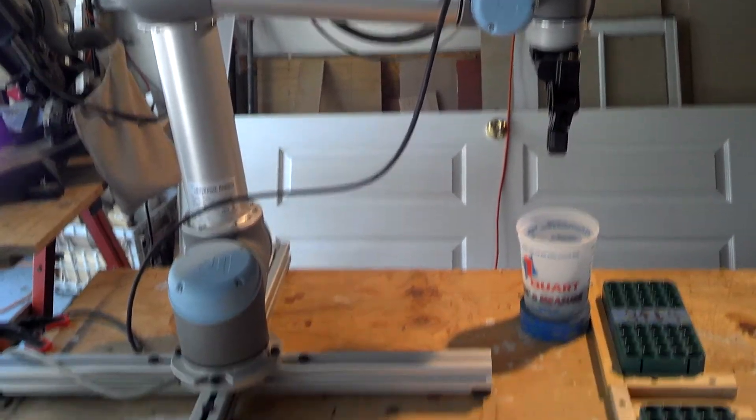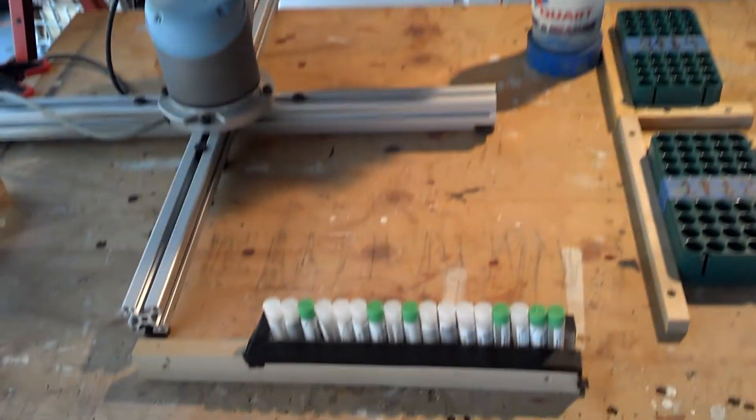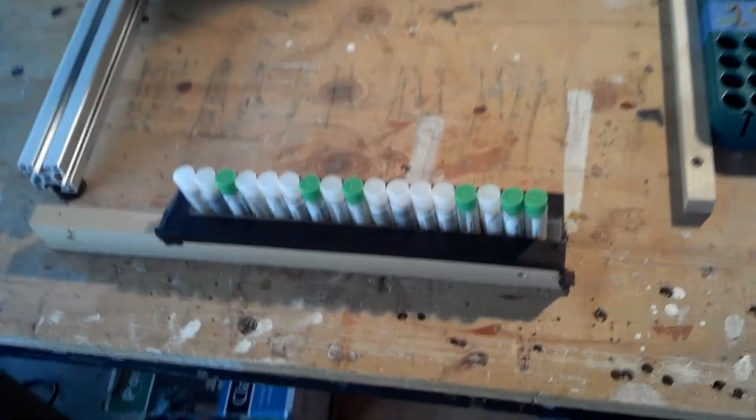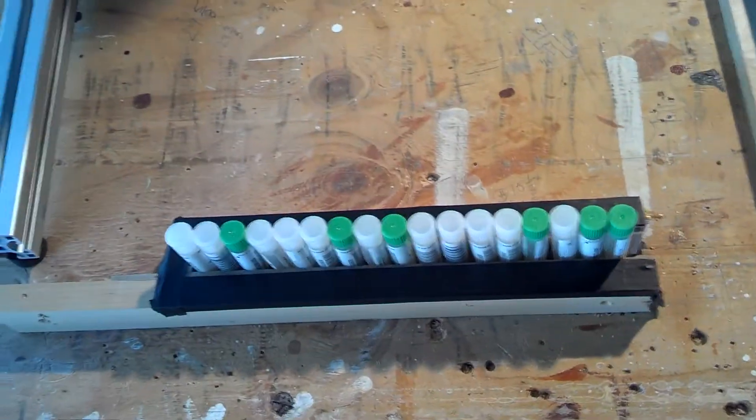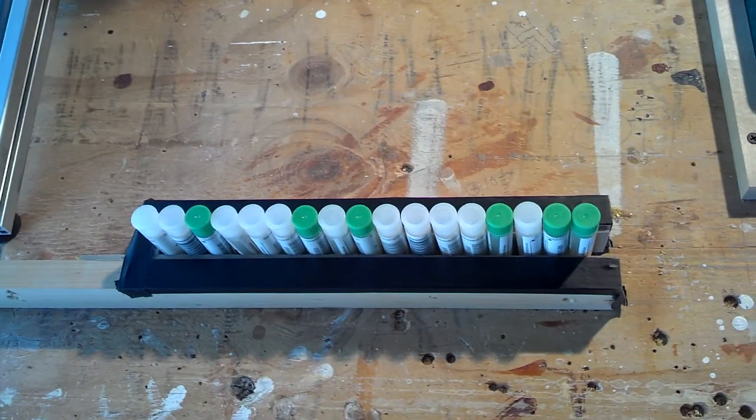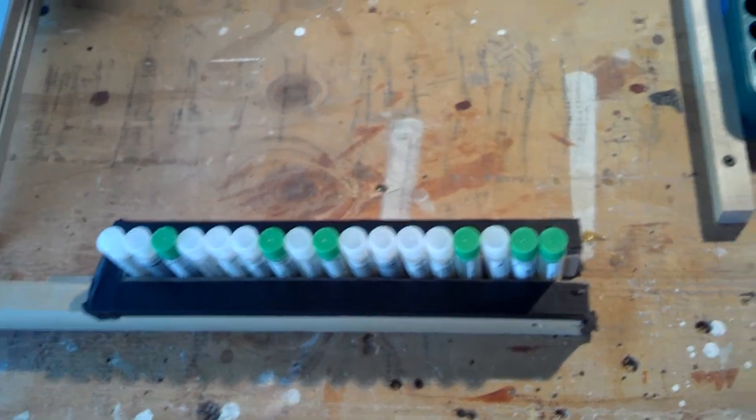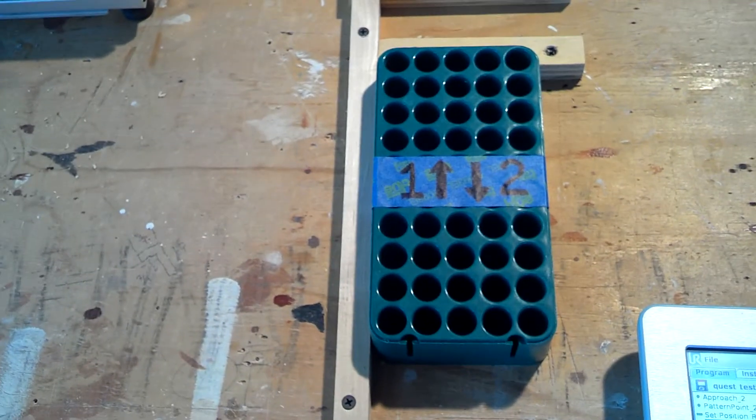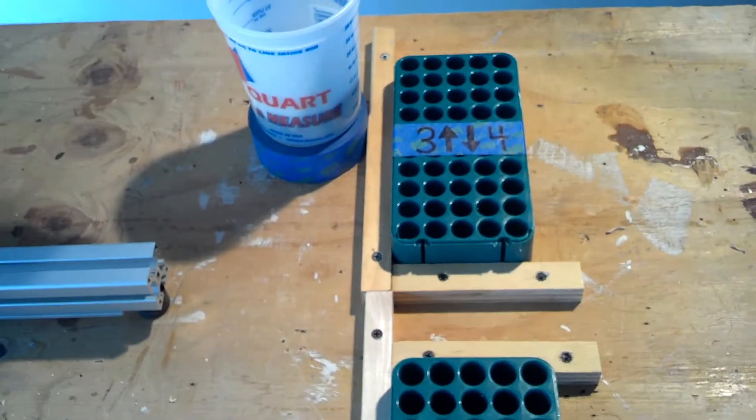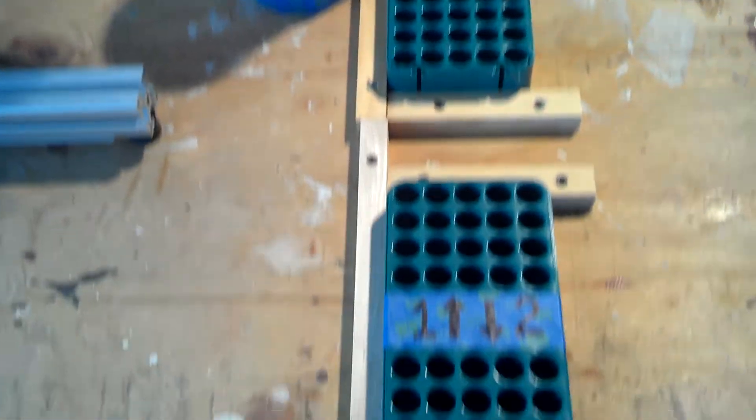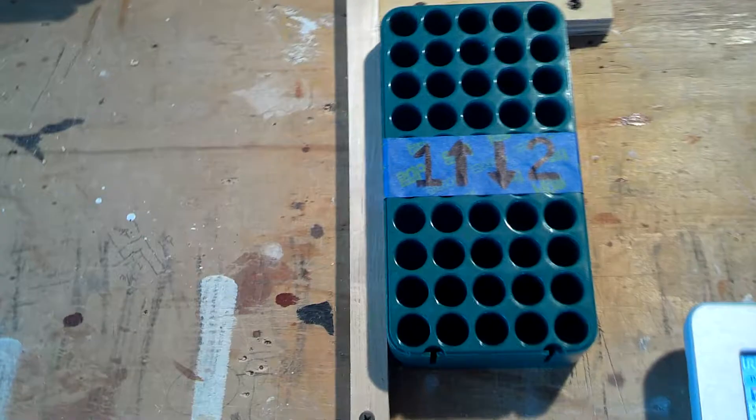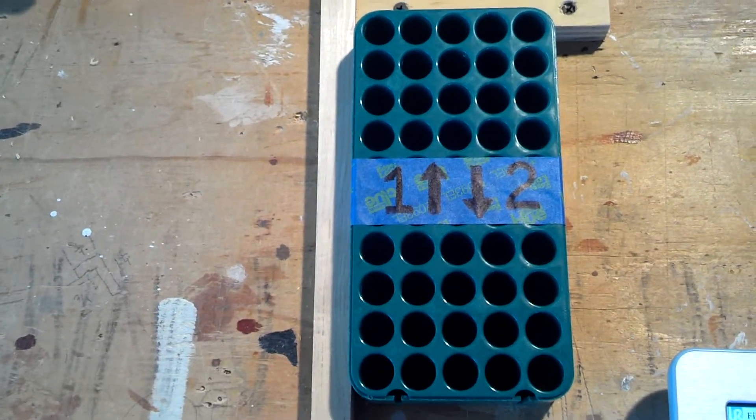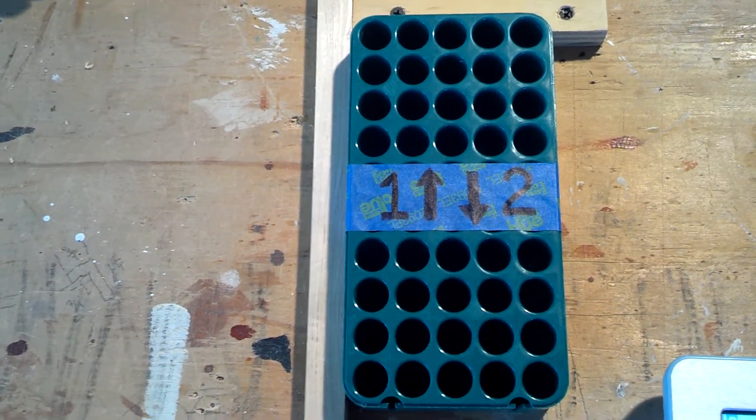There's the robot and I've just set up the test tubes in a makeshift little feeder line here, and then I have two of their pallets or trays set up and divided each one into two separate trays.